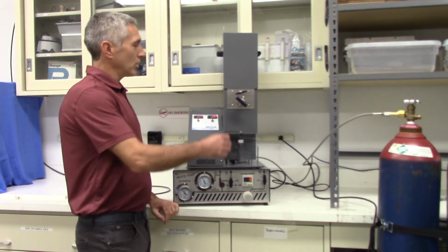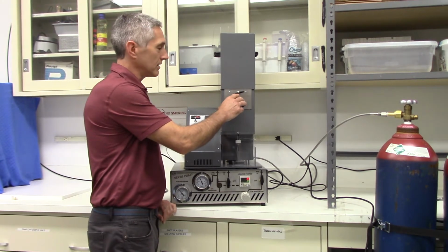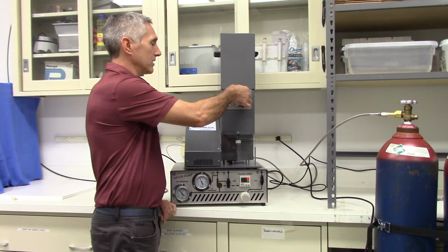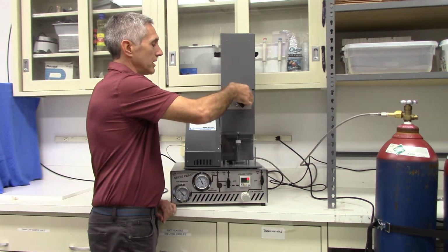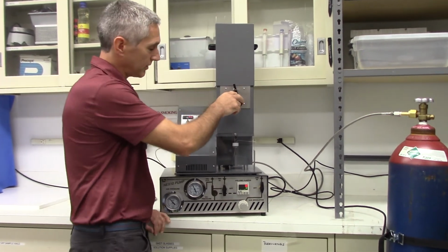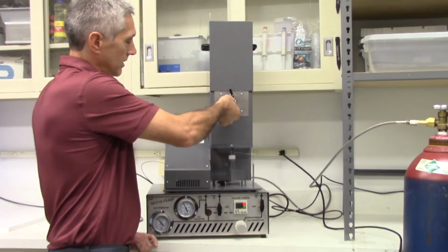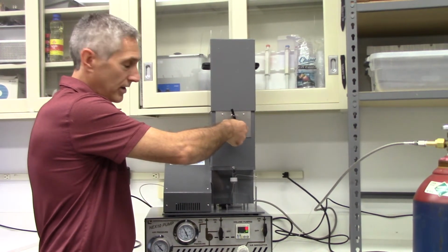What that means is we'll open the static dynamic valve before we open the back pressure regulator. So we open this valve, all the way. That allows flow to the back pressure regulator, which will allow us to flow into our sample. So we start cracking this micrometering valve open.